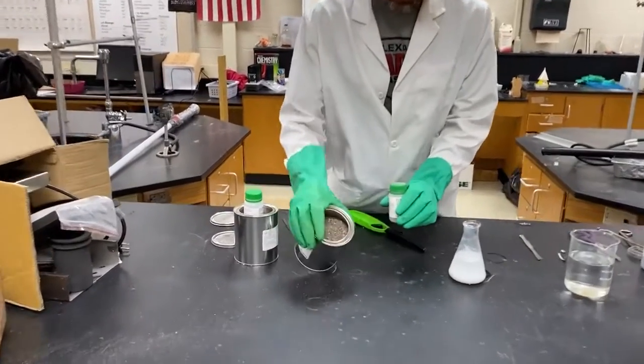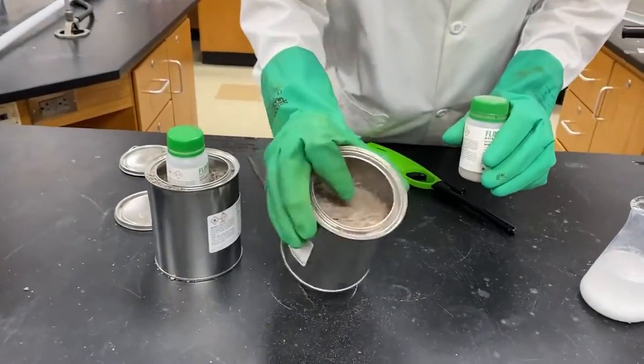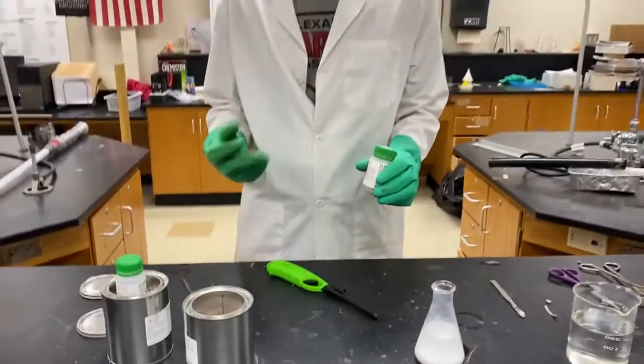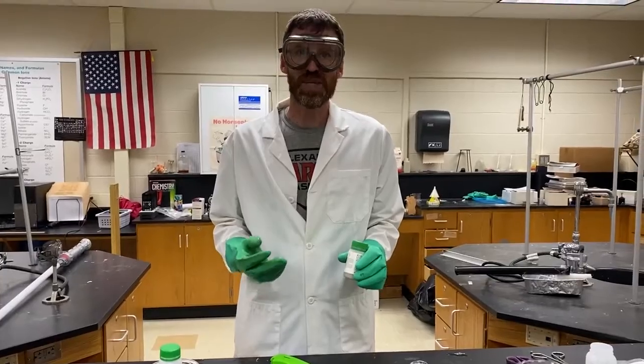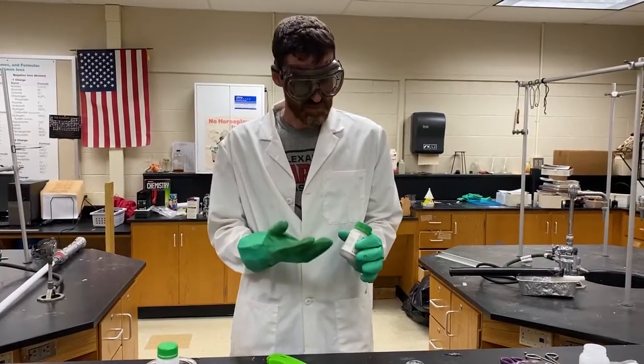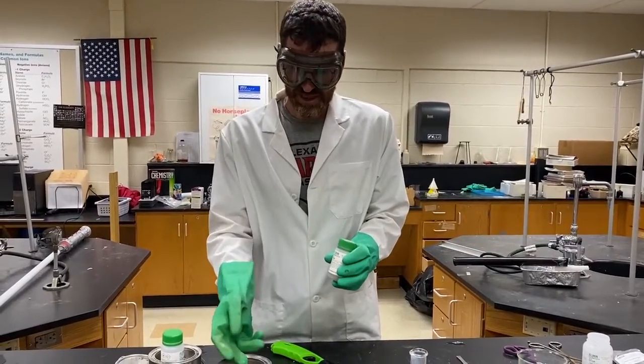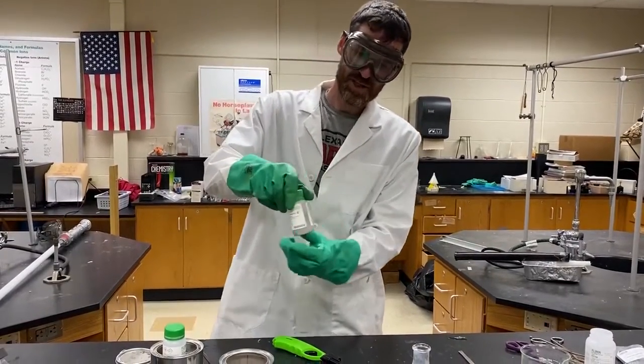It is in what is kitty litter. It's stored in kitty litter. Well, what is kitty litter good at? It is very good at absorbing moisture. The moisture from the air, this stuff will react with it so readily that we have to store it in kitty litter. Now, also there's a liquid in there.